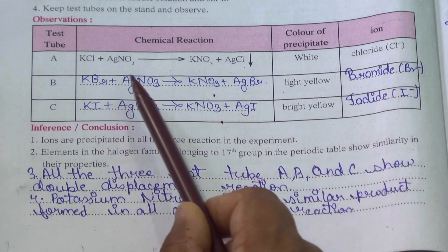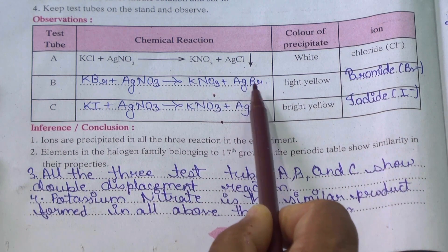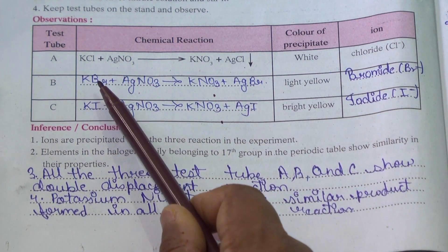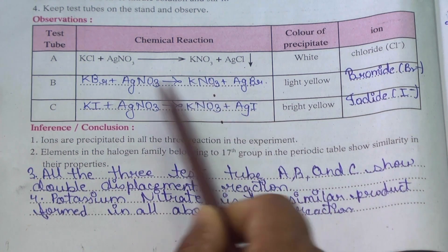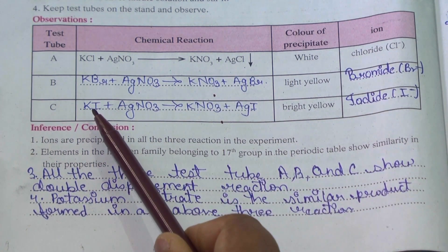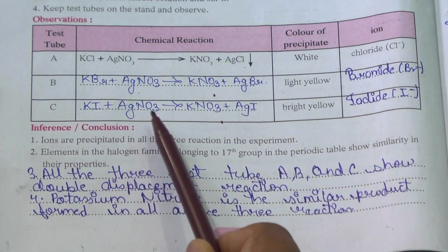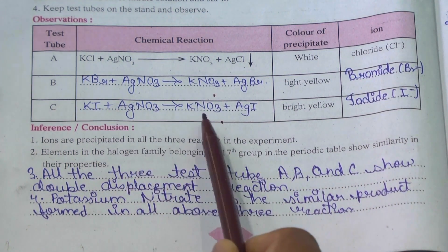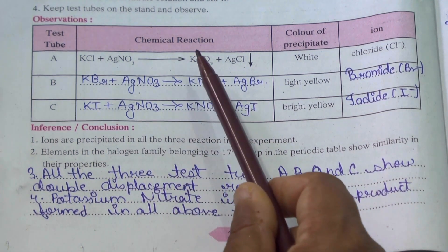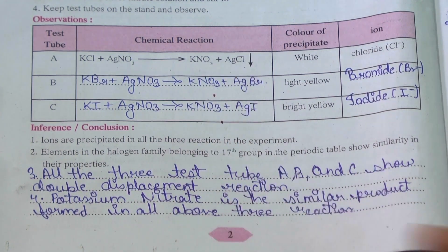Similarly, bromine bonded with silver and formed AgBr, and NO3 moved to potassium and formed KNO3 — therefore double displacement. Similarly, iodide moved with silver and formed AgI, and NO3 moved with potassium and formed KNO3 — so double displacement. In all three reactions, KNO3 was commonly formed and there was double displacement.